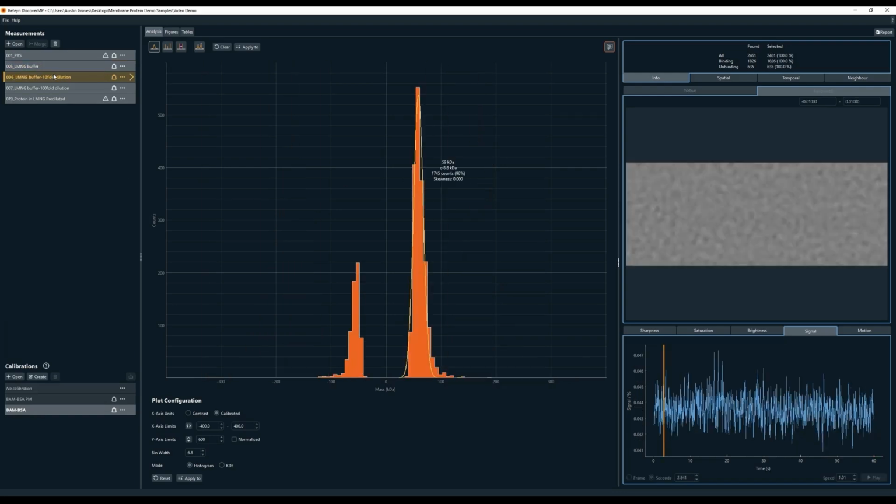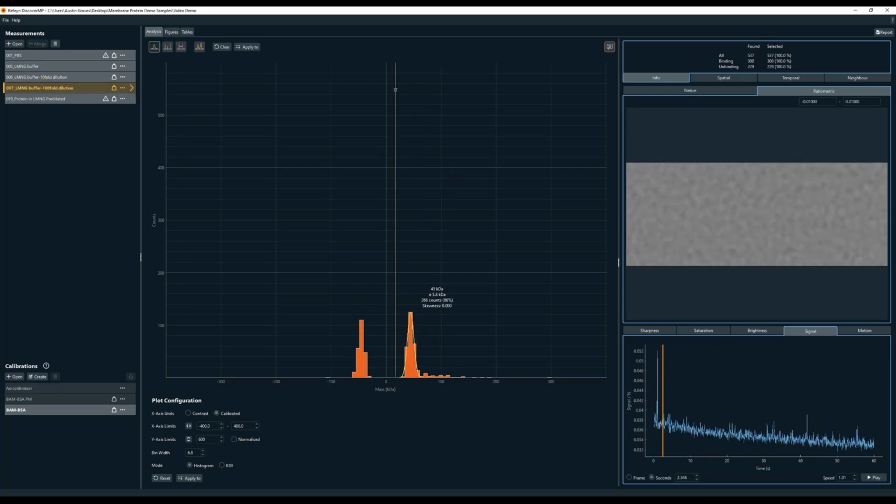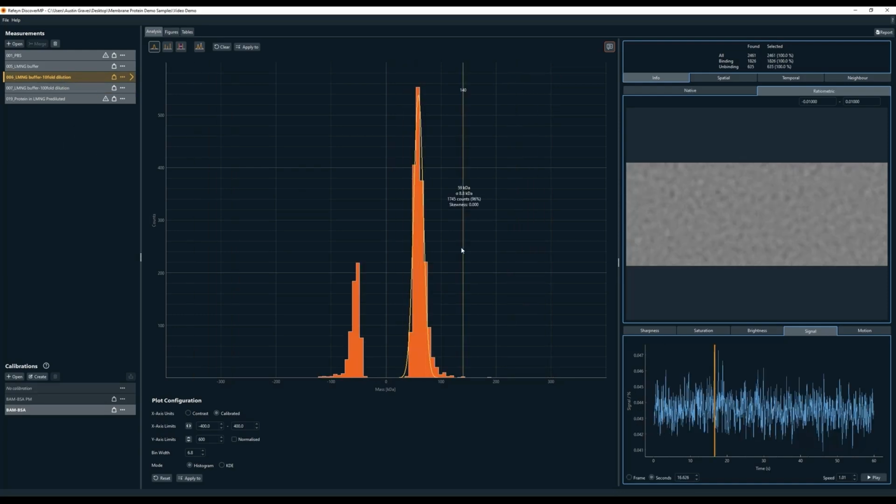Now, if we dilute the LMNG buffer just 10-fold in PBS, we can still see some background signal, but the movie and the data have cleared up considerably. Now, once again, how much signal we can tolerate is going to depend on the size of the protein. So if we were looking at something that was 60 kilodaltons or smaller, this still wouldn't be dilute enough. So if we go down to 100-fold dilution, we can reduce the background signal even further. The protein we're looking at in this particular experiment happens to be over 100 kilodaltons, so a background peak at 59 kD, like this, would be perfectly acceptable.